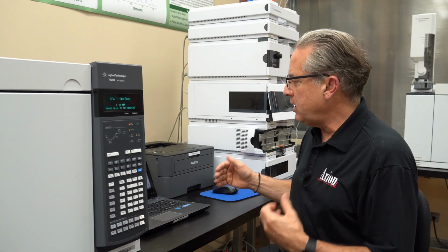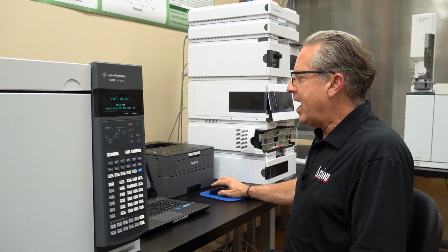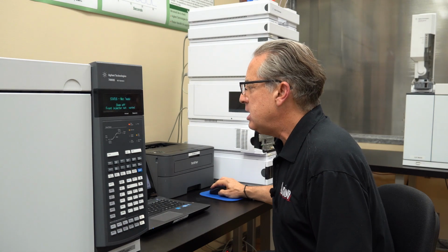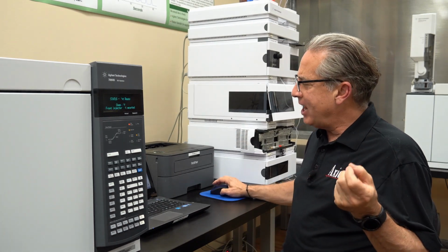So if you're running the software, and this is the typical ChemStation software, this is B.04.03, and in it we have control of the GC itself. So let me first go up here and stop the run that we were collecting before. And now I want to show you how to actually assign the test plot.